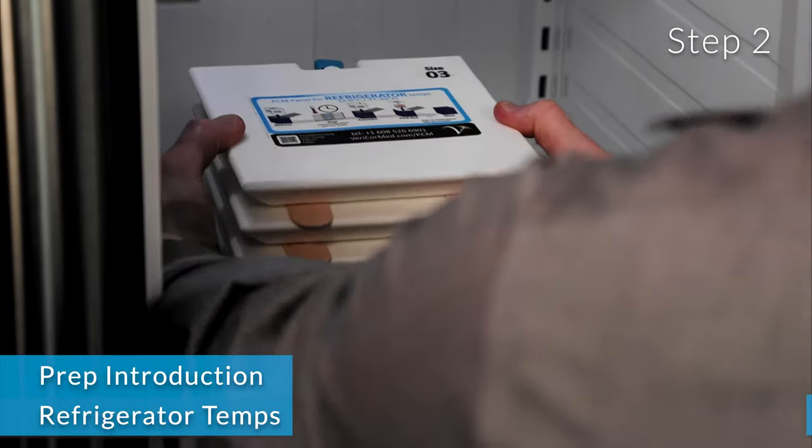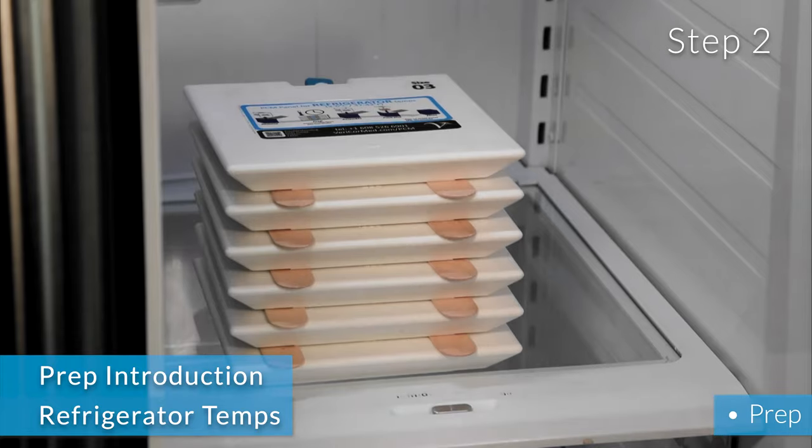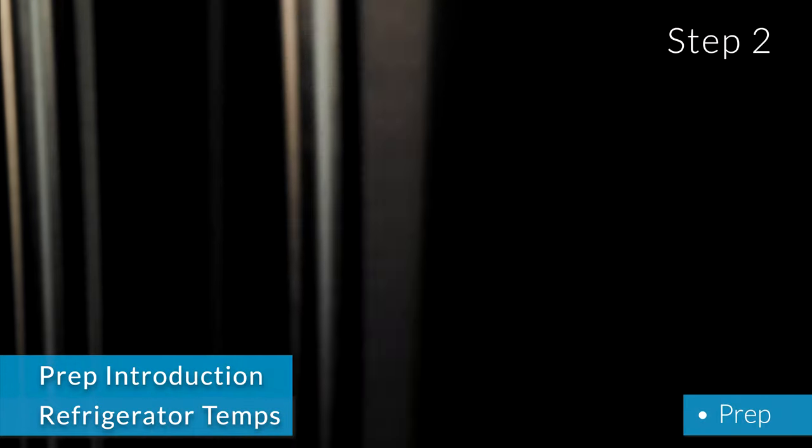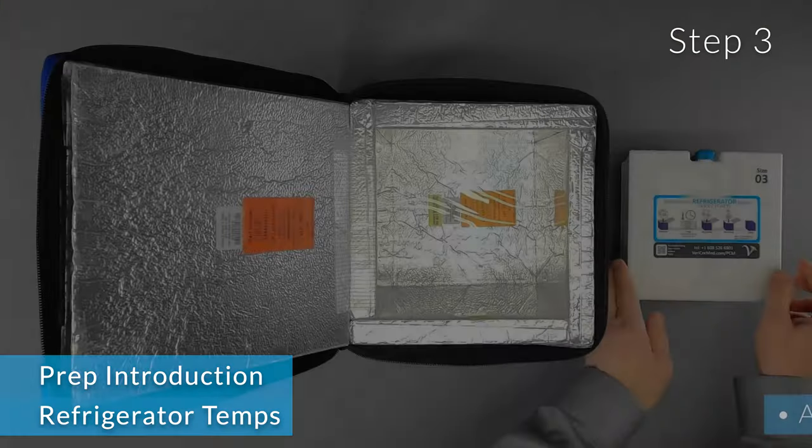Step 2: Prep the panels. Step 3: Reassemble the panels.